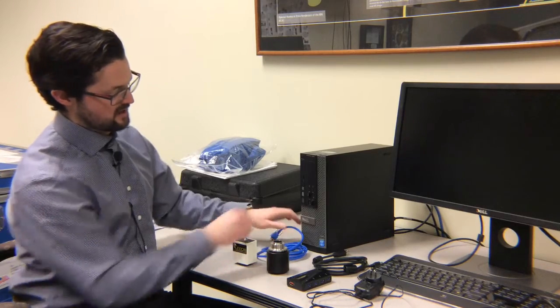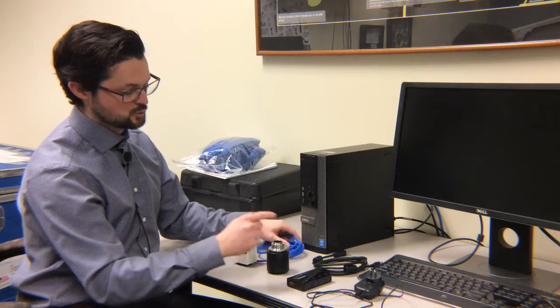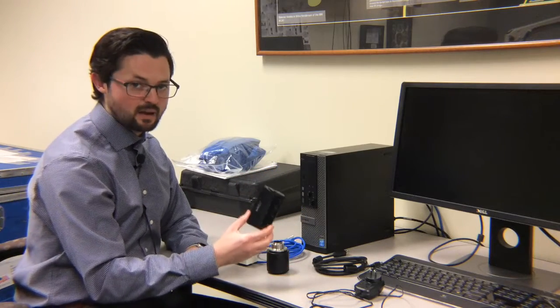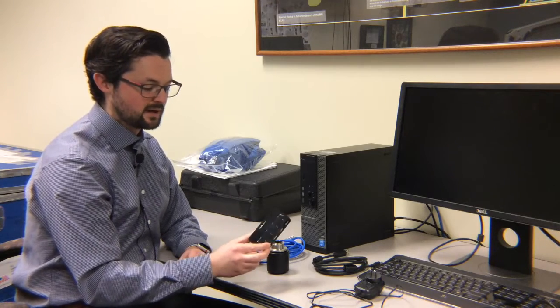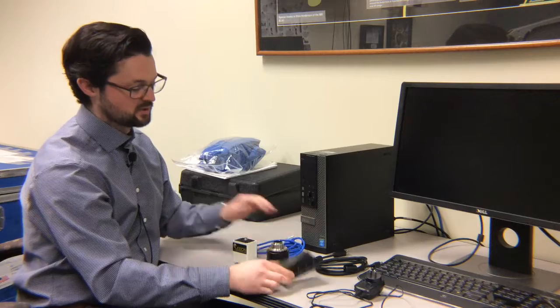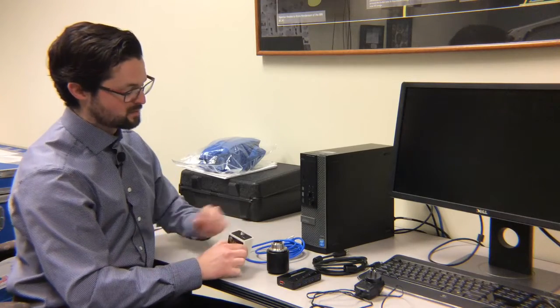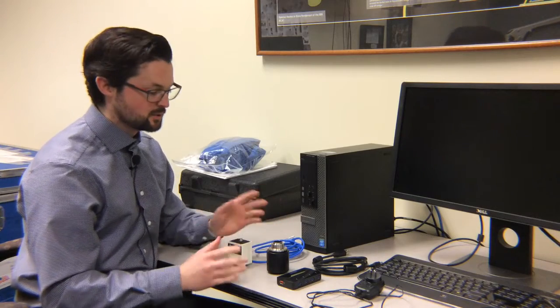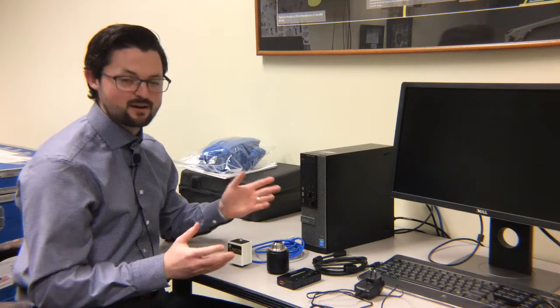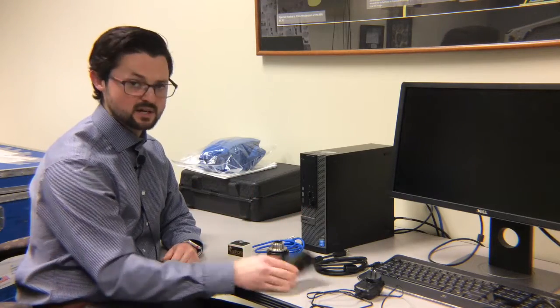You'll also have your USB 3.0 cable that runs from the camera to the StarTech powered USB 3.0 hub. Now the reason we supply this camera with this cable and this hub is because this camera pulls power through the USB cable and some computers don't have enough power moving through the USB ports to provide enough juice for the camera. So that's why we have this hub.